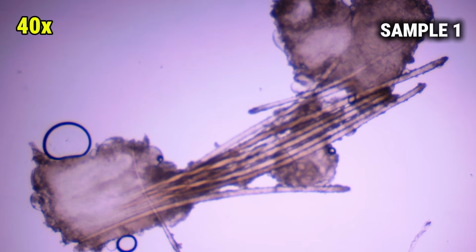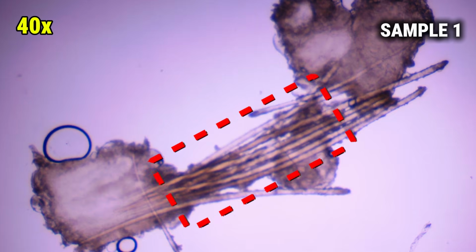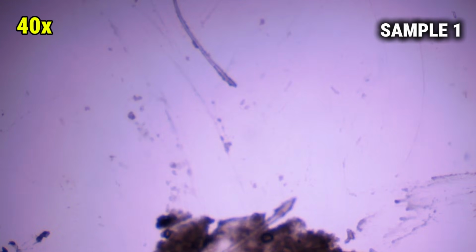All right, this is sample 1. We're looking at it under 40x magnification. That stringy material stretching across the slide is mostly a mix of keratin and sebum. Keratin comes from dead skin cells, and sebum is the oil your skin naturally produces. When those two build up inside a pore, they can form a plug. Gross, which is exactly what we're seeing here.